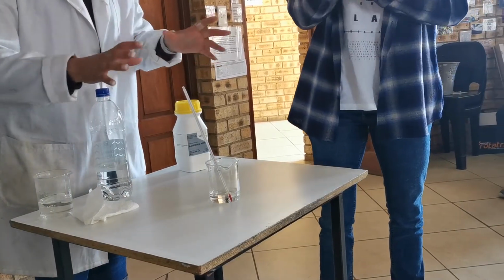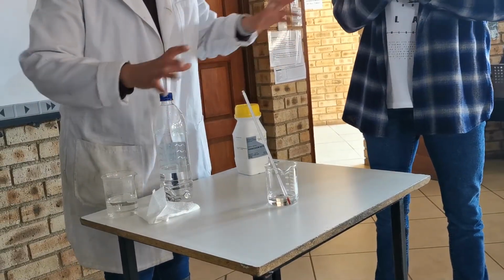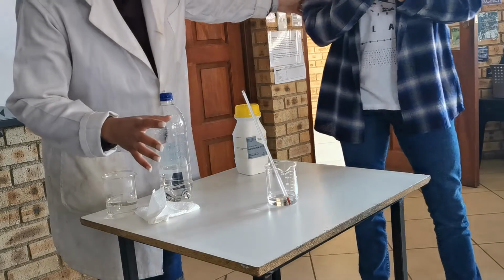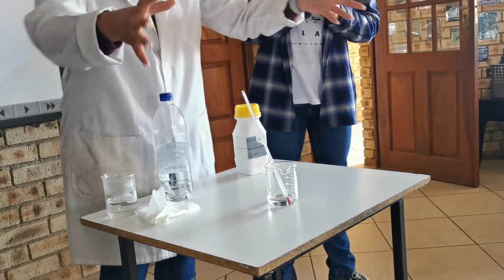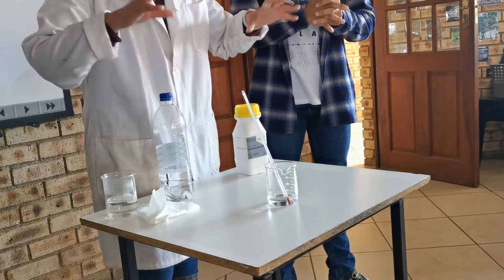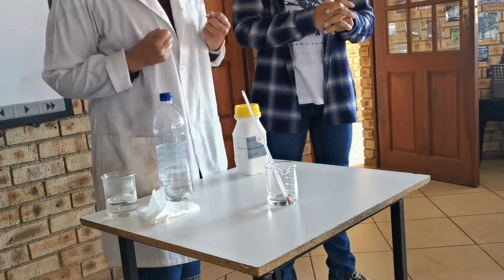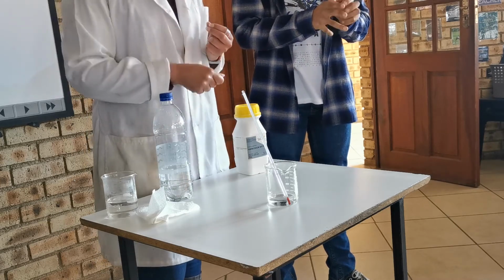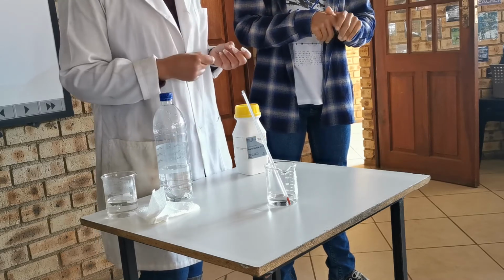Okay, the second type of reaction we're dealing with is an endothermic reaction. Heat is taken in from the surroundings. The reaction itself doesn't have enough energy to give outward to the surroundings, so now we're going to pull energy in from the surroundings. So we're expecting a temperature decrease. I don't know if this is going to work today because it is already quite cold.